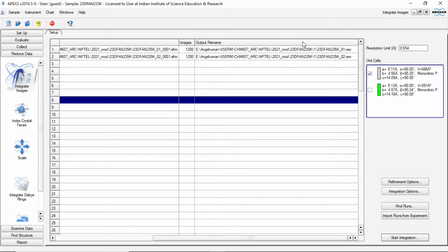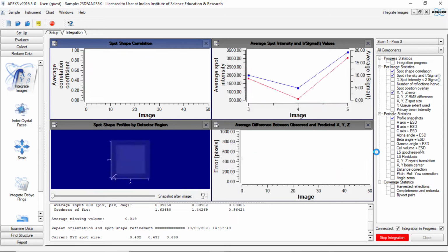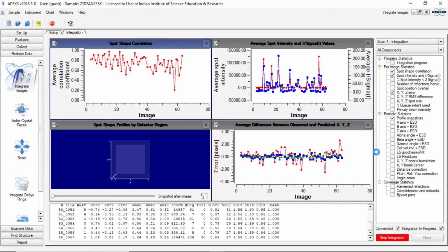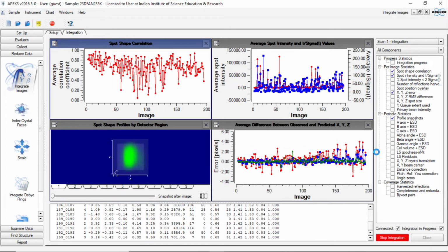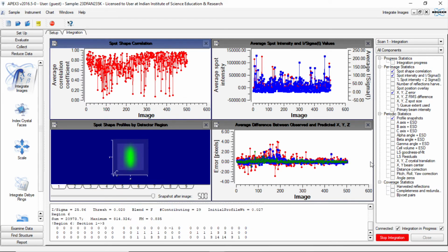So what it will do is it will read 1200 frames from each of these sets and use the indexing matrix from the gray unit cell and give you the data reduction files in the folder 1. So let us start the integration. This integration will take a while, because you see this will read 1200 frames from each of these runs and then extract the data from those 2400 frames. And in front of you, you are seeing the data reduction process is going on, and it continuously calculates several parameters related to this data reduction process.